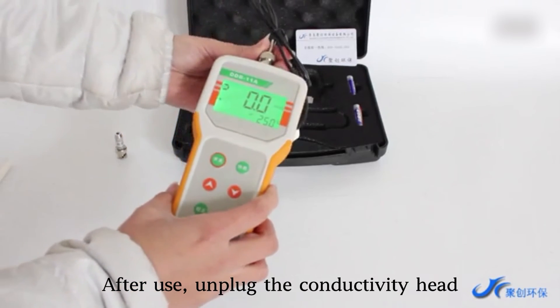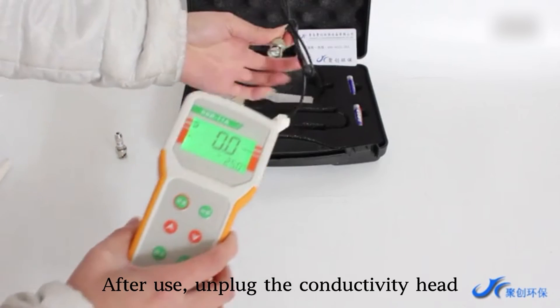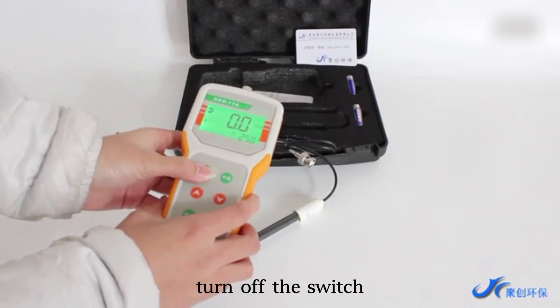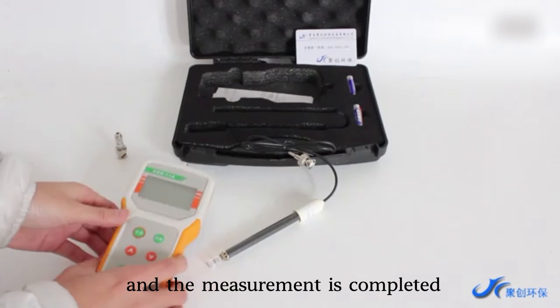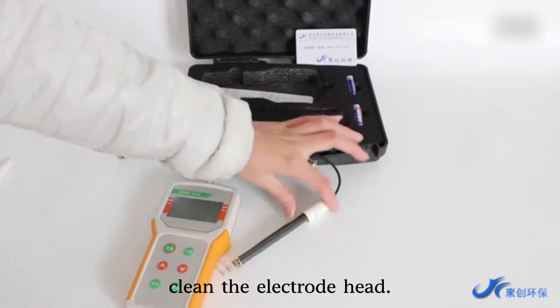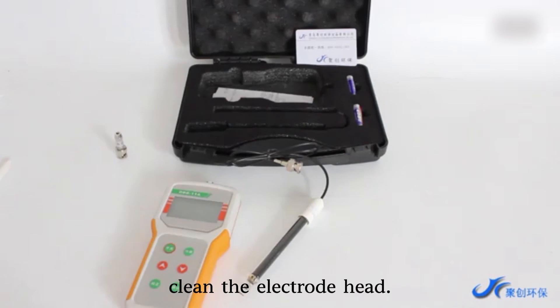After use, unplug the conductivity head and turn off the switch. The measurement is completed. Clean the electrode head after use.